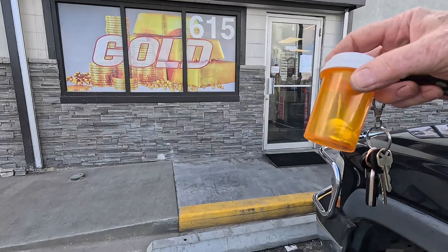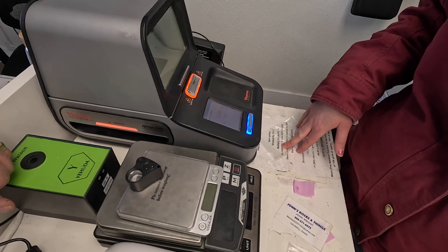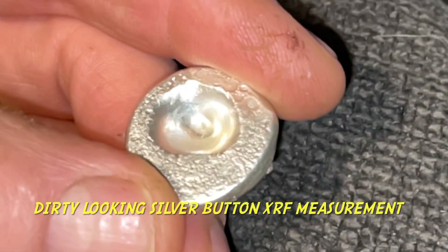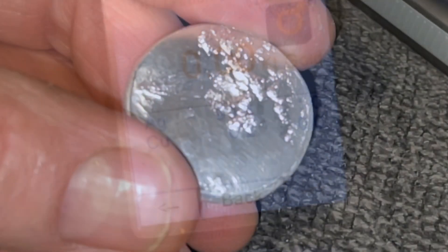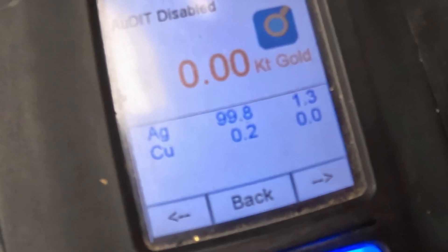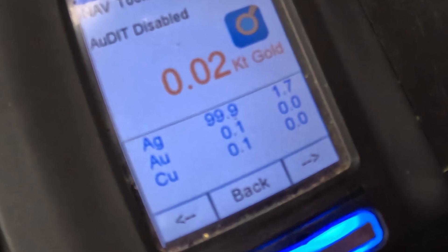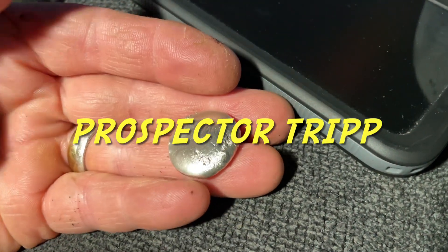That's right. We'll get these dudes XRF'd, see what we got in there. The professional's taking care of us guys once again. Looking pretty pure right now — almost all Ag, almost delicious. Beautiful, thanks. Let's come through. We'll be right back.